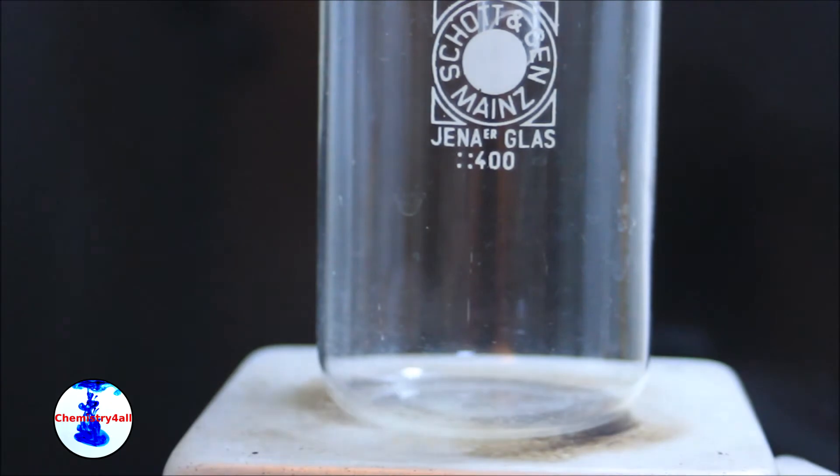After an hour and a half, the system is allowed to cool down and the solution is filtered to remove the solid residues left within the pills.